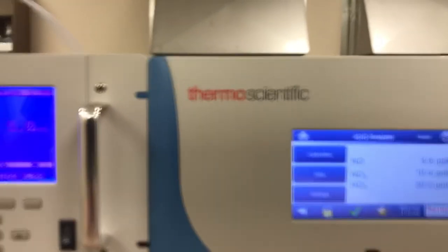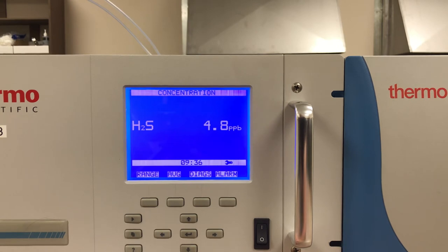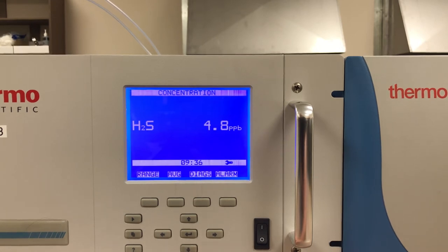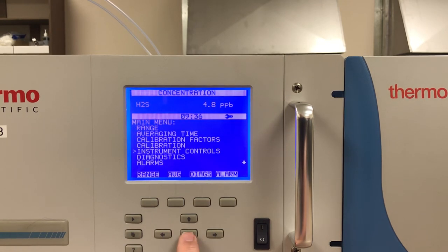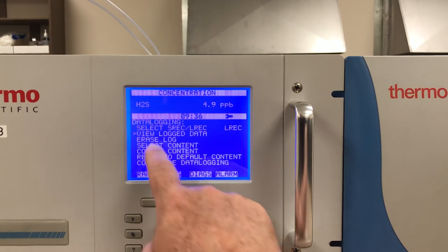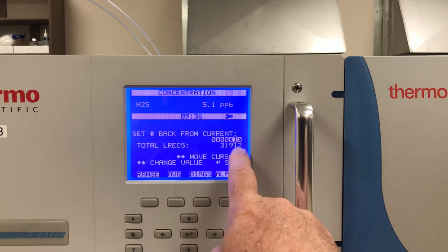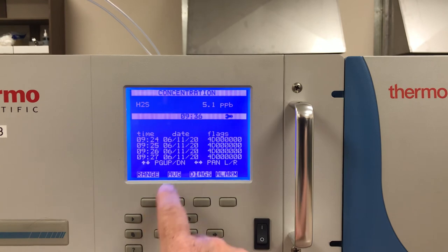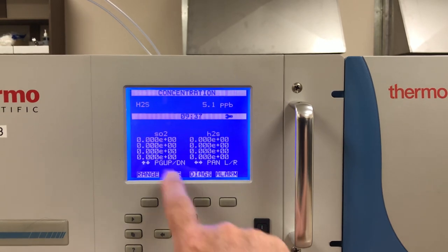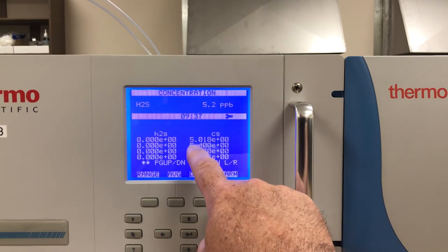Going back to the i-series one more time — to look at data on the i-series, you would need to have Thermo iPort software loaded onto a laptop and a cable connected to the back port to download the data. To view data on the i-series, simply press menu, go down to instrument controls, then go to data logging settings. In this data logging screen there is a view data log option. If I press enter, I can set the number of records — say show me 10 records back — and here's the data showing time, date, and any flags. I can press the right arrow to show SO2, H2S, and CS combined sulfur, which is labeled as CS on this H2S analyzer, with a reading of 5.018.